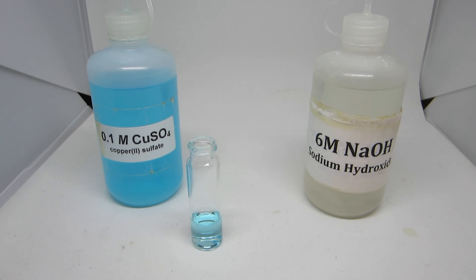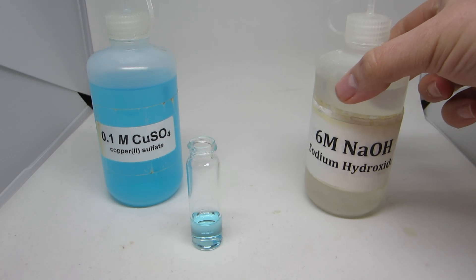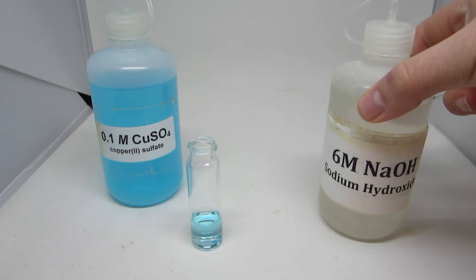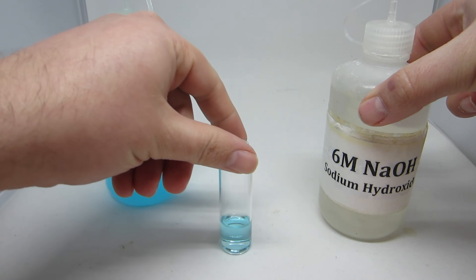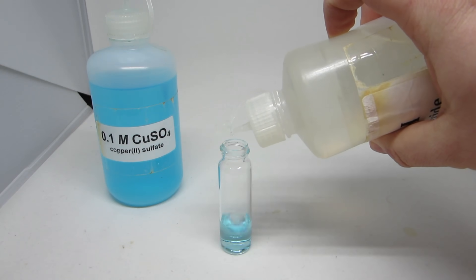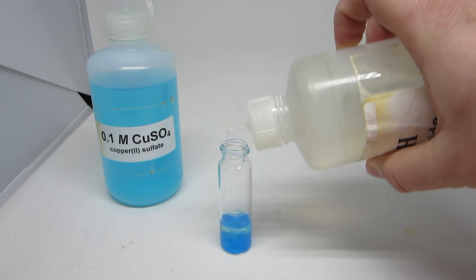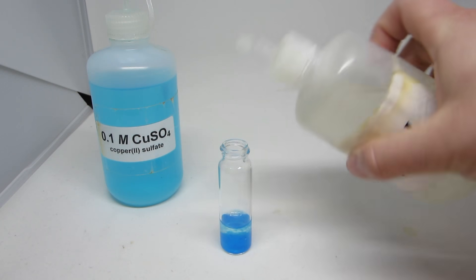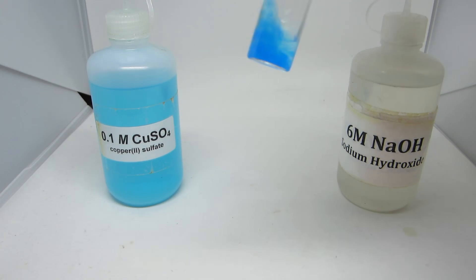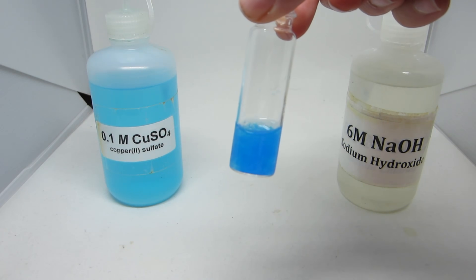The fifth reaction consists of adding a small amount of clear and colorless sodium hydroxide to the light blue solution of copper sulfate. When doing this, you can see the intensely blue colored precipitate that forms in the reaction.